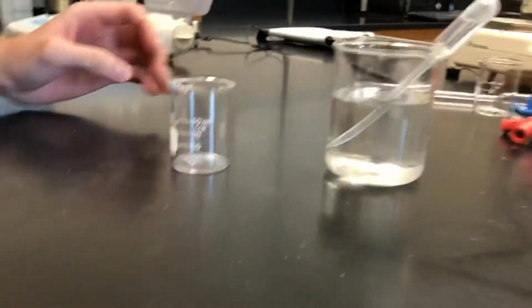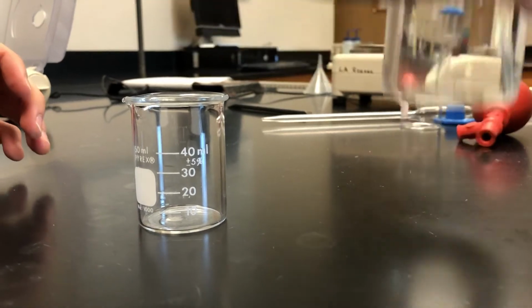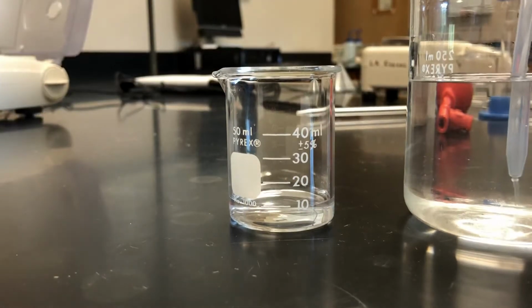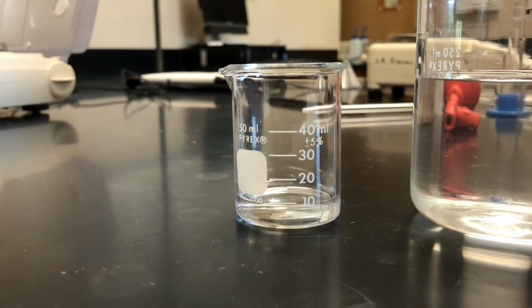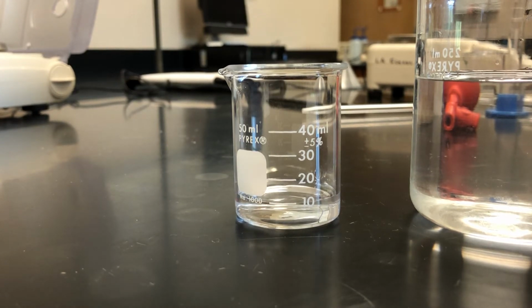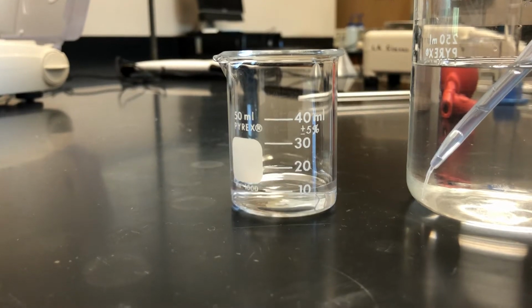So we've got a beaker of water right here, as well as a pipette. We can use the pipette to get closer volumes. So I'm just going to fill it close to 10 milliliters. You can see that's a little under 10 mils. So I'll use the pipette here to add a little more, dropwise, a little more slowly. Then we get it to about the 10 milliliter line. So now we've gotten our 10 milliliters of water into our beaker.